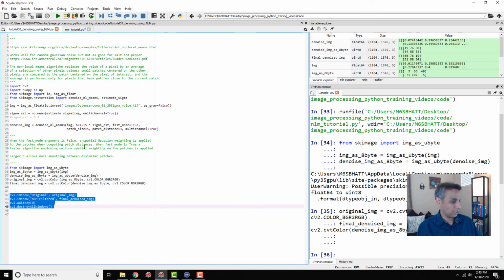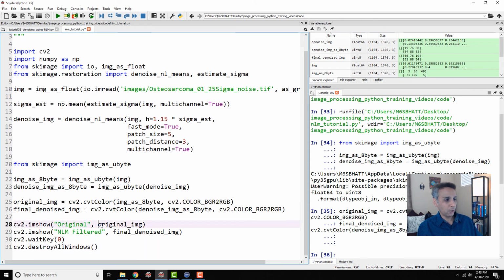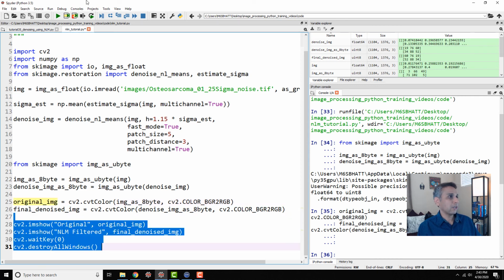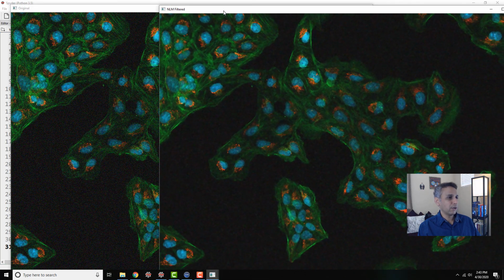So let's use cv2.imshow right there. I'm going to look at my original image, which is the image that has been converted to 8-bit and also BGR to RGB. I did exactly the same for my denoised image. So let's visualize our images. And here is the NLM filtered, and here is the original image. As you can see, very nicely denoised, and the edges are also very nicely preserved. Now it actually makes things pop. Look at these nuclei there.